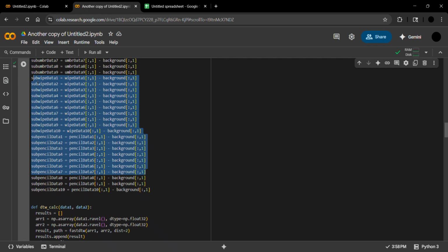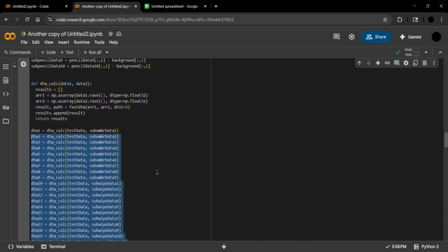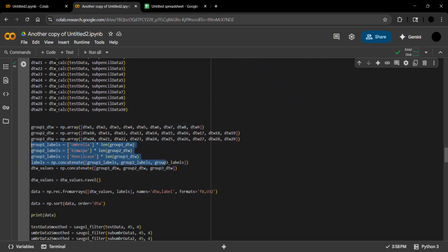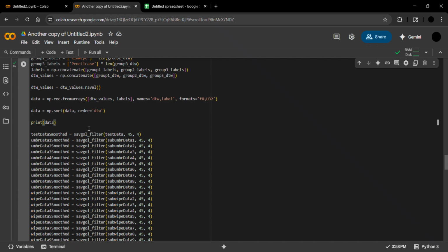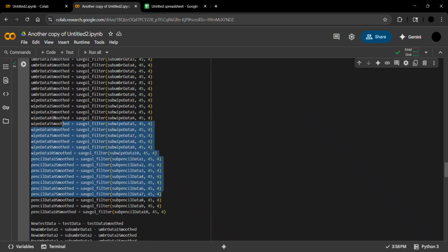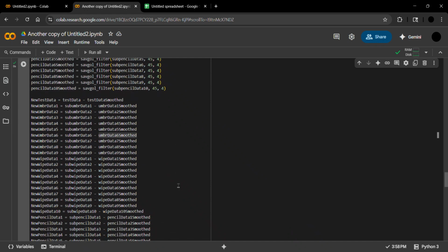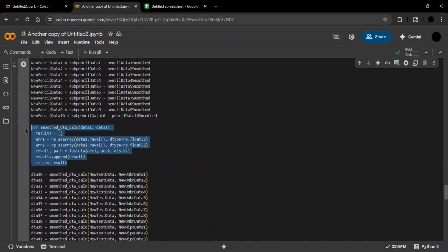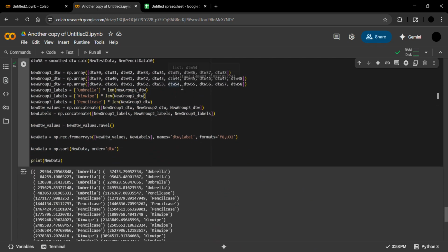The background is subtracted, as I mentioned just before. Then the dynamic time warping function call is done using the test data against all previous trials. Labels are added for each dynamic time warping result to know where it is being compared against. This is printed raw compared to later where we have noise reduction done by the Savitzky-Golay filter, again adding a noise baseline through smoothing filtering, and that'll be subtracted much like the noise data set previously shown from each trial. Here we have the second dynamic time warping call, which is used because the dimension of the data changes after the Savitzky-Golay filter. And again, this is printed with the label being shown again.